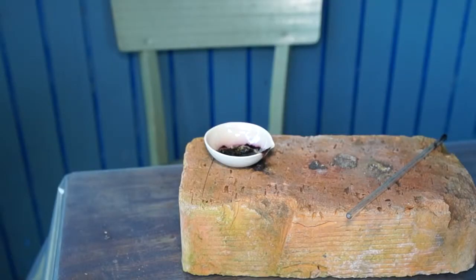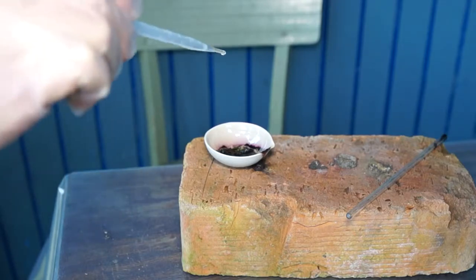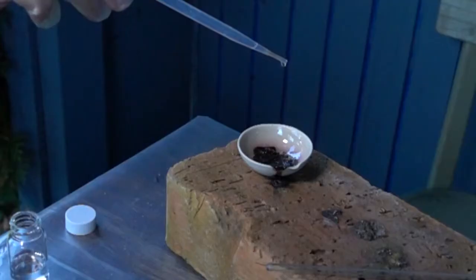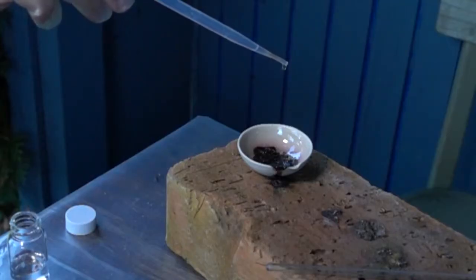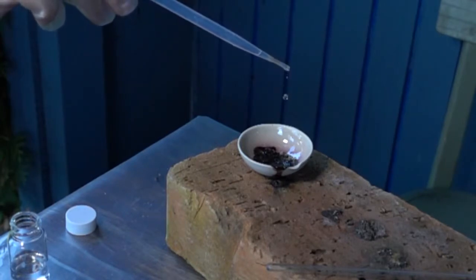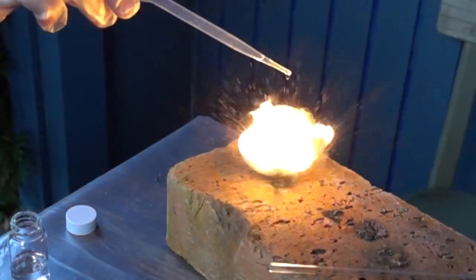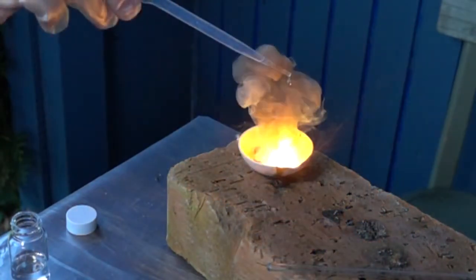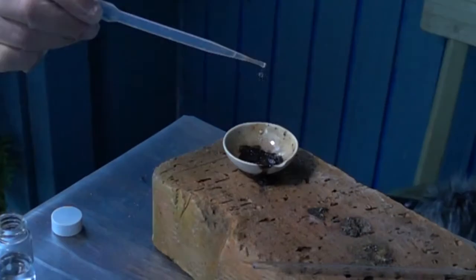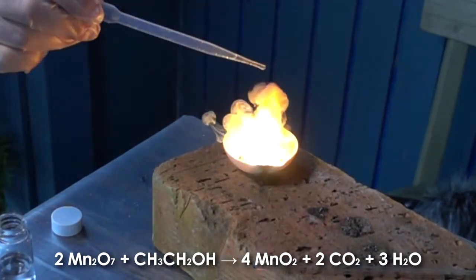Let's do the same in this evaporation bowl. The reaction is very rough and sometimes is accompanied by an explosion. This is what happens.